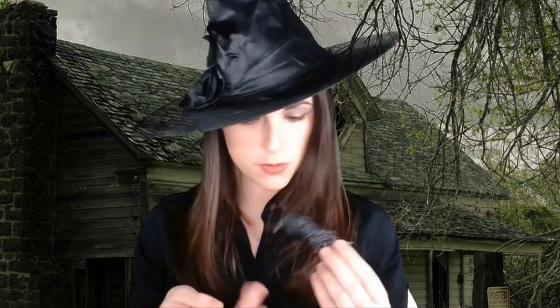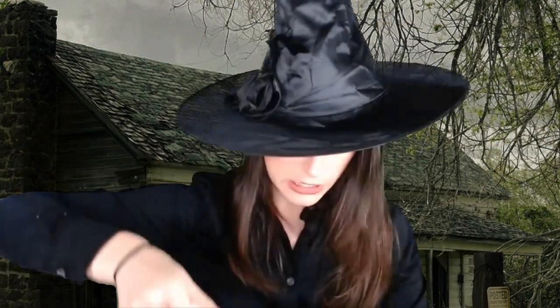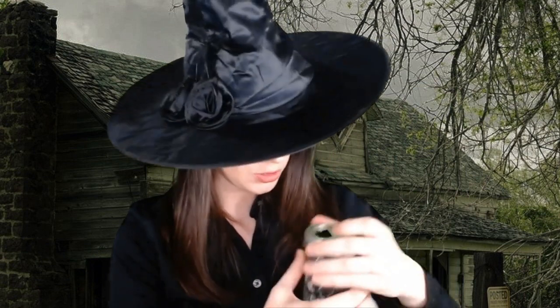Two eyes of stag. Three wings of bat. One very large spider. Splash of bleach. And a cup of what I'm pretty sure is water.